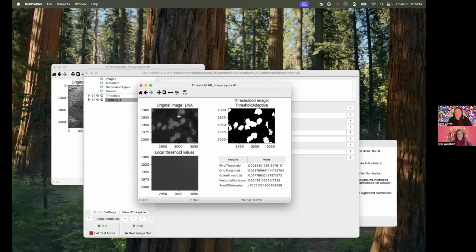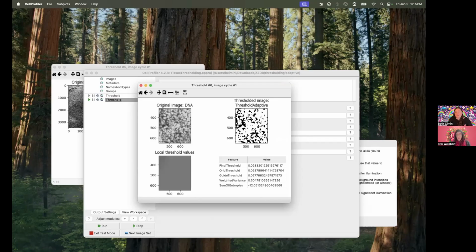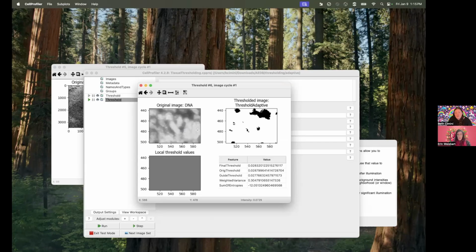And so I just zoomed in on a super dim area. This area looks like it's actually fully capturing everything now. And if I zoom in on a really bright area, it's still picking up a lot. It's picking up a lot more than I would really prefer. But there is a lot of out of focus light going on here. So this big region where there aren't nuclei, it is now catching that there isn't, and some of the other breaks between them. There are definitely more things, and we're going to talk in further episodes about how you can tweak the thresholding algorithm even more to get more strict or less strict.